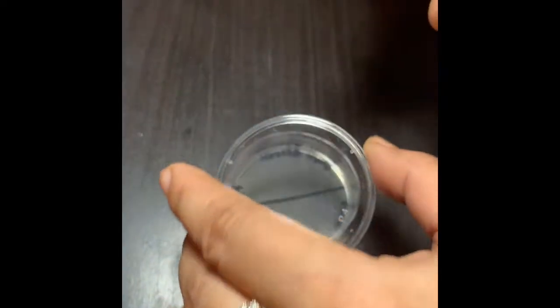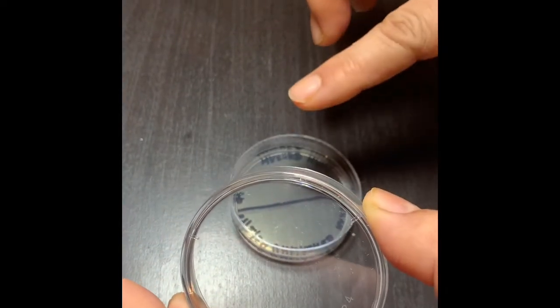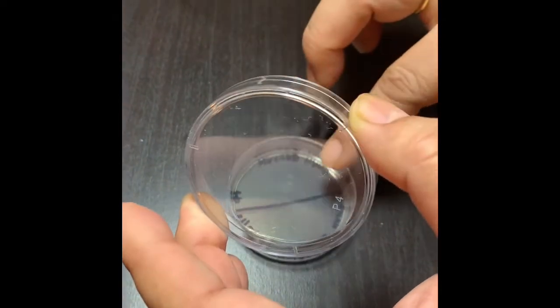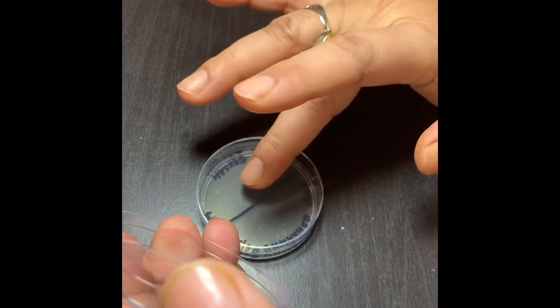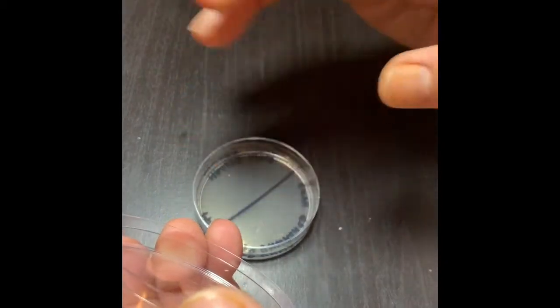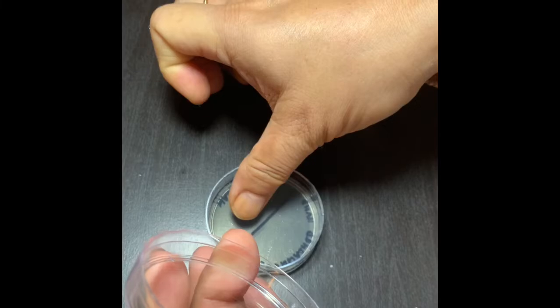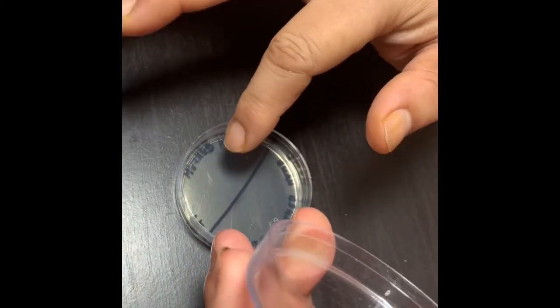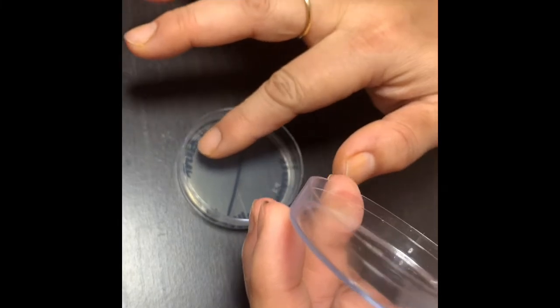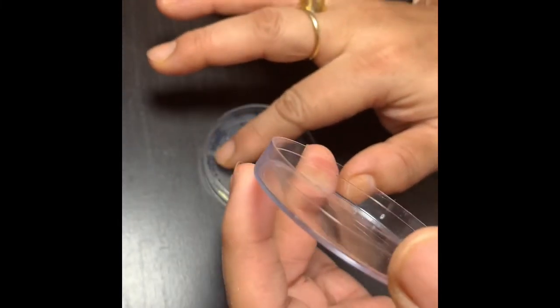After washing, I'm now touching the agar plate on the area where it is written washed hand. I'm touching with all my fingers and we'll see what happens. We really get interesting results with washed hand versus unwashed hand.